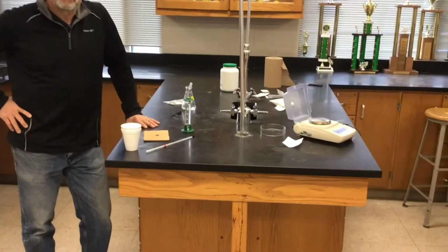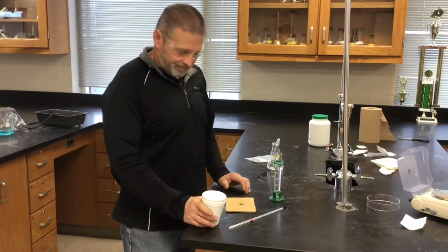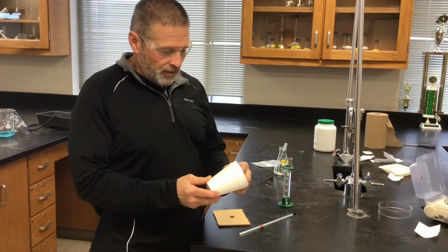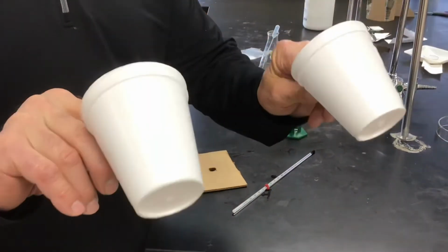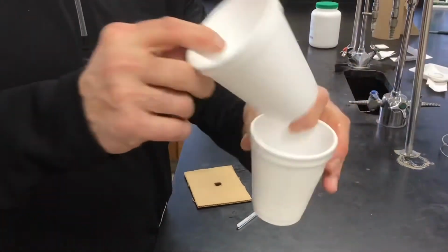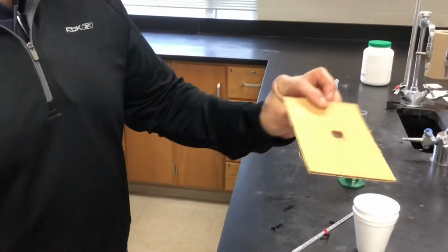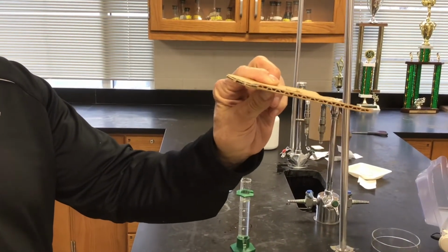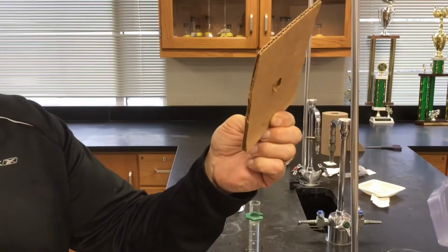Well, it looks like we're set up for an experiment. We are. Mr. Moore, coffee cup calorimetry on a Friday afternoon. That's awesome. So, coffee cup calorimetry, of course, means using coffee cups. And in Troy, we believe in using nothing but the finest for our students. So we're using not just 1, but 2 styrofoam cups nested together. It's very nice equipment. And this is our precision high-tech lid that we're also going to use. You just don't find these anywhere. It looks like it was made in America.